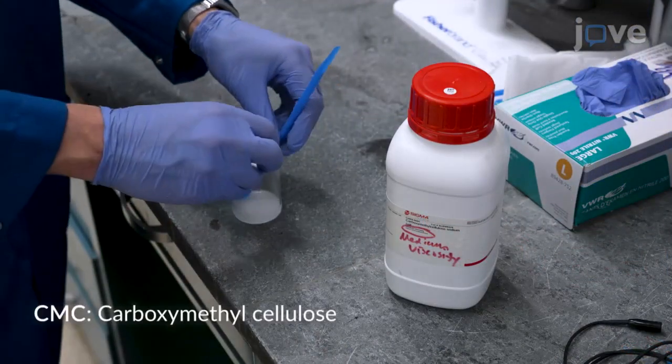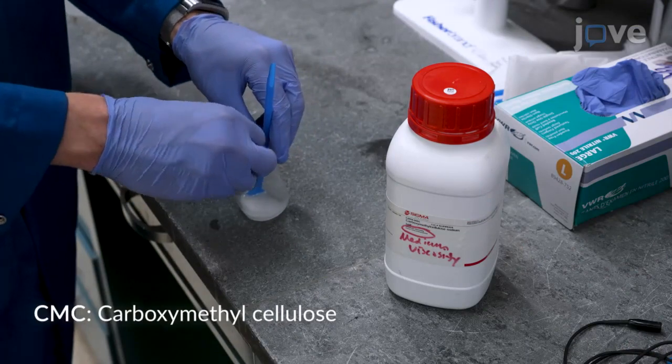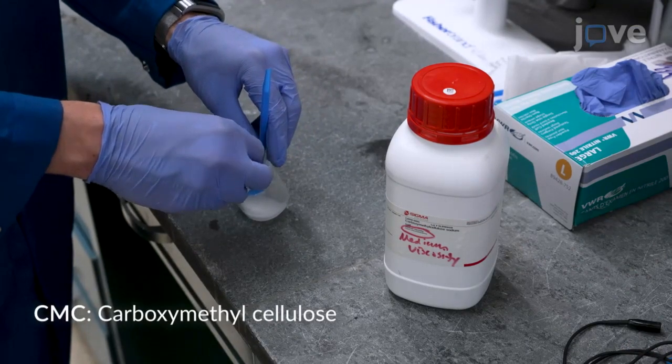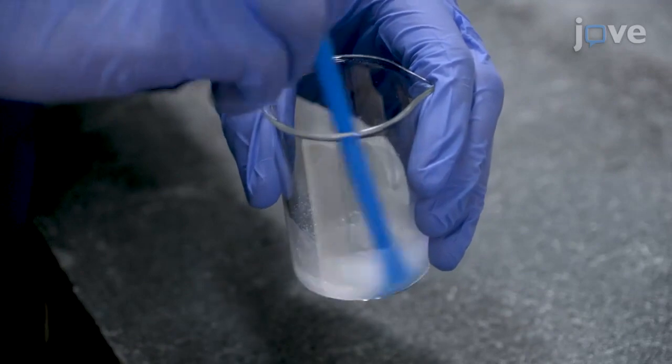Next, add 5 milligrams of water-soluble medium viscosity CMC sodium salt to the beaker and stir for 5 minutes or until dissolved.